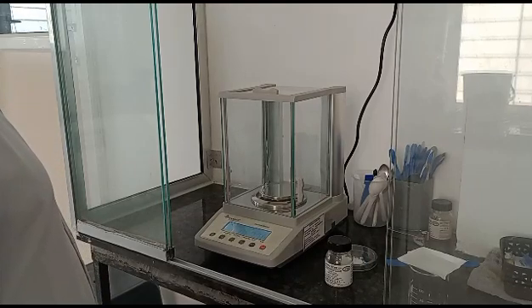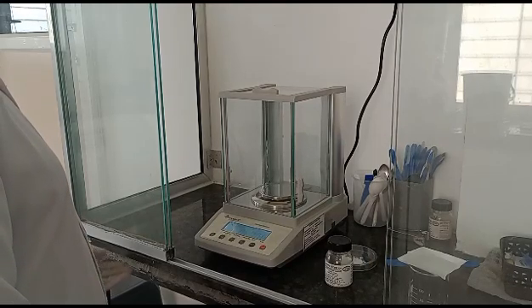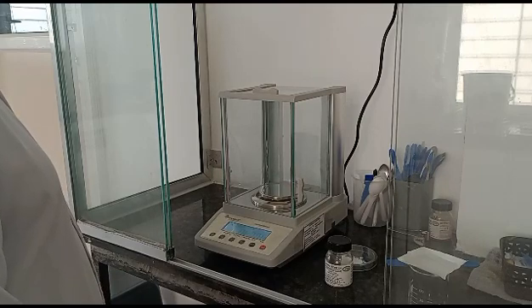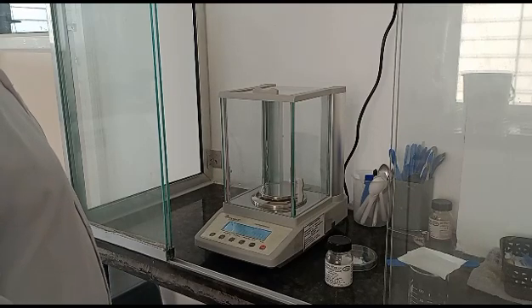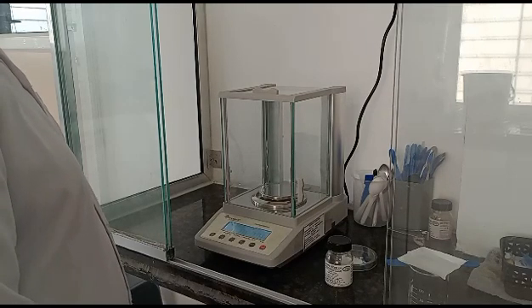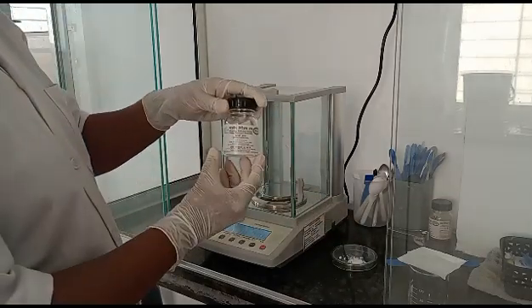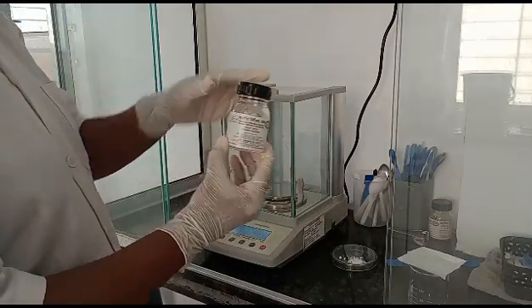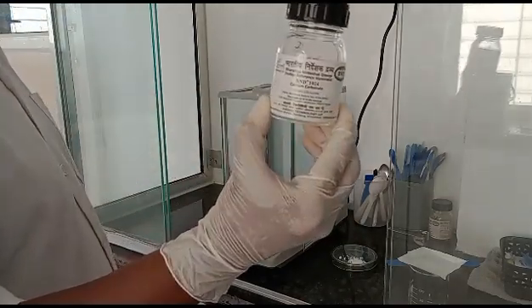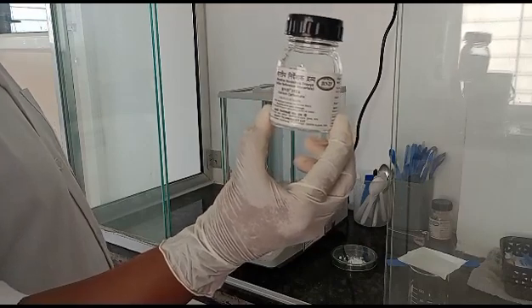For the standardization of 0.01 molar EDTA, we basically require a primary standard, that is calcium carbonate. Here you can see the bottle of calcium carbonate. It is a CRM, that is certified reference material.